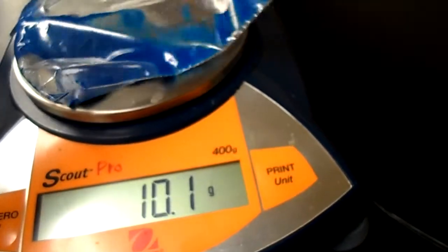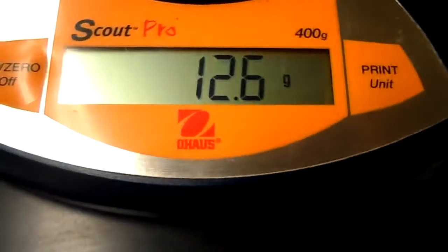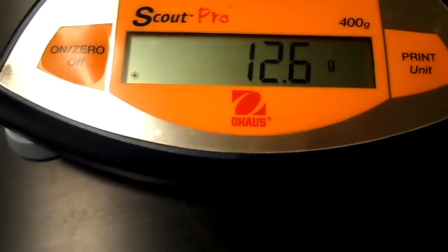Okay, the reaction is complete, so make sure you notice the observation, or notice what's inside the bag. So now it just looks like a deep blue color, okay? And now what it asks us to do is to weigh the contents. I want to make sure I get the contents on the scale. Okay, so now the mass of the bag is 12.6 grams. And the last thing it's going to ask you to do is to open the bag and take the temperature.